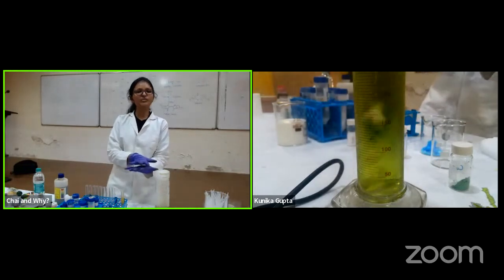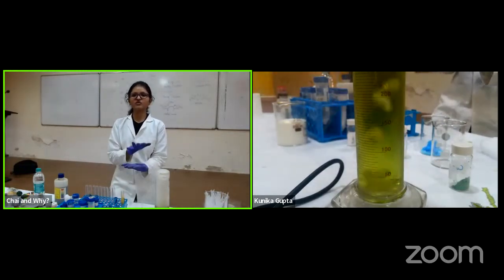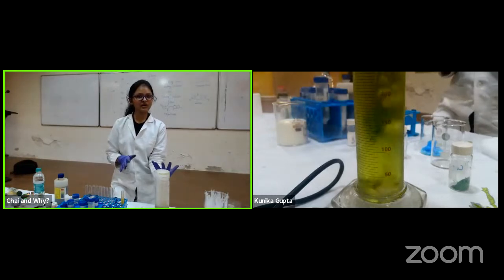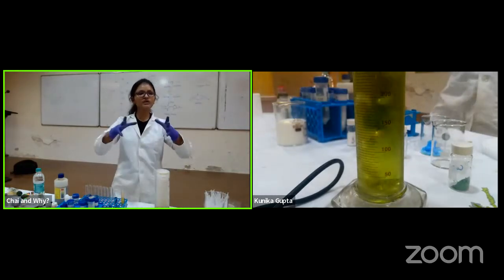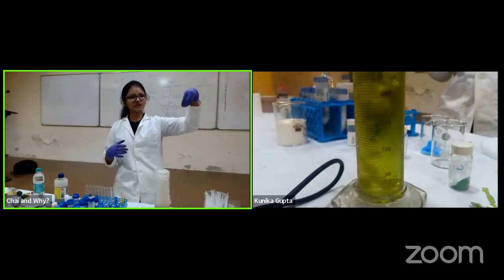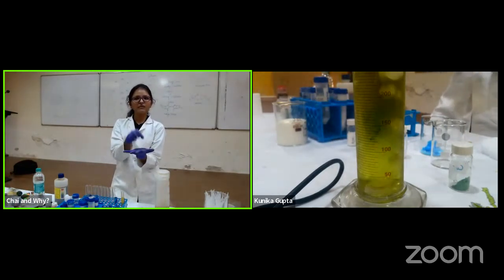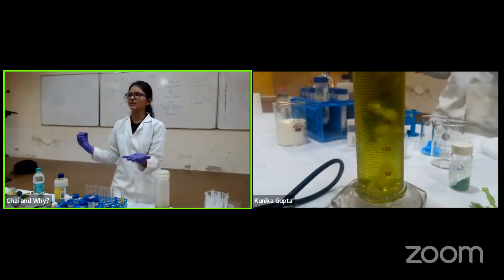So how am I going to make these cells survive? Cells need an optimum pH, and they need a lot of things, but I'm just talking about the factor of pH. So how are we going to control the pH in a cell which is out of my body? We use this particular technique: we put them inside an incubator supplied with carbon dioxide. The cells are in a media, something from which they get the nutrients they can eat up. How will the pH be maintained? For that we use a carbon dioxide incubator.